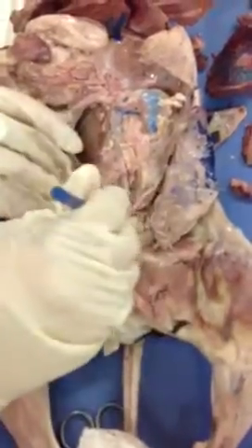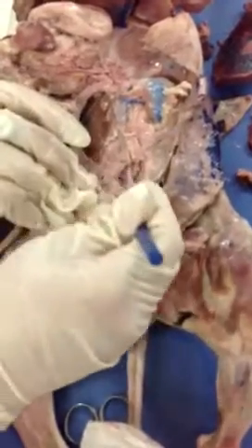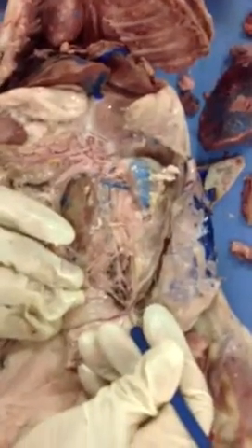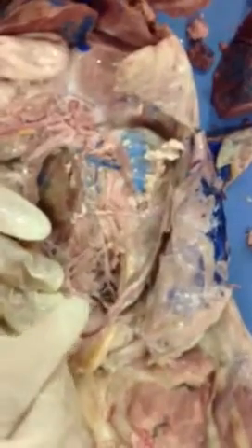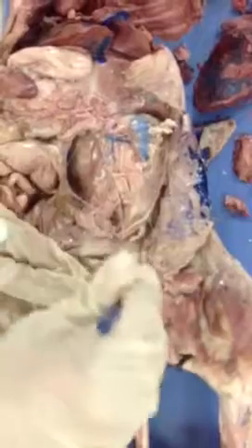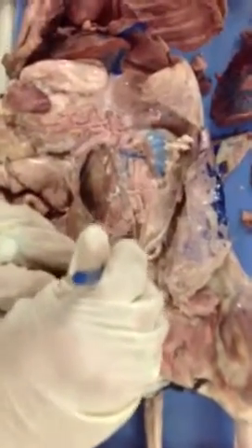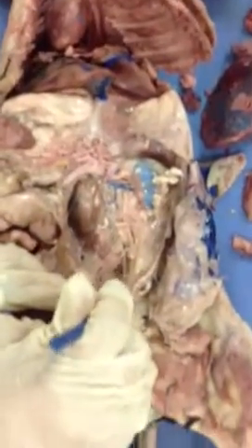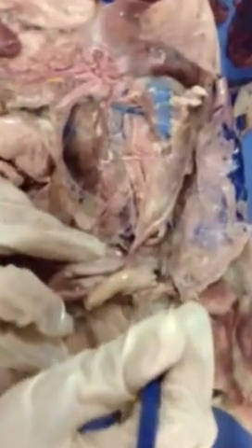Internal iliac. And you notice that here, on the inside, we see these small caliber blood vessels. So this is going to be my right internal iliac, and this is going to be my left internal iliac. Go on, please. Caudal. And the caudal is hard to see because it has to be deep inside there, and they're very small. So they're going to be literally inside of it. Deep femoral.